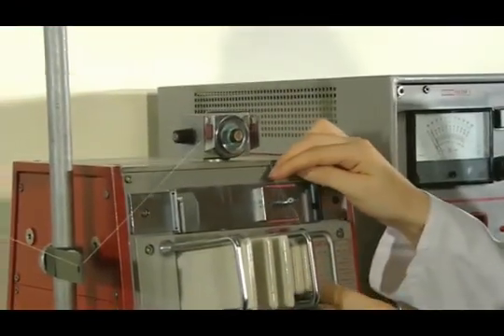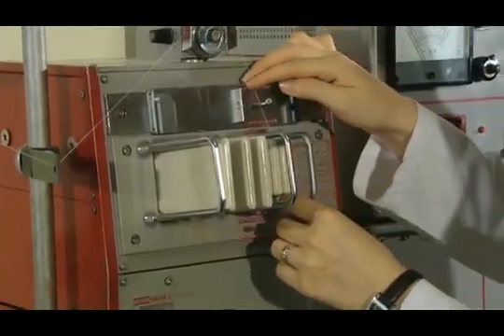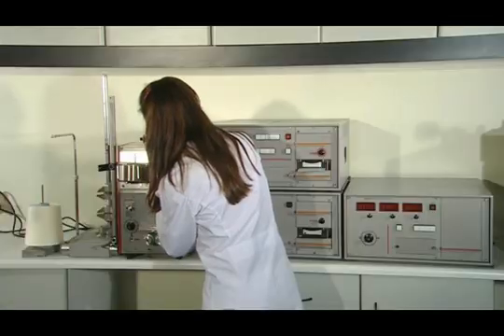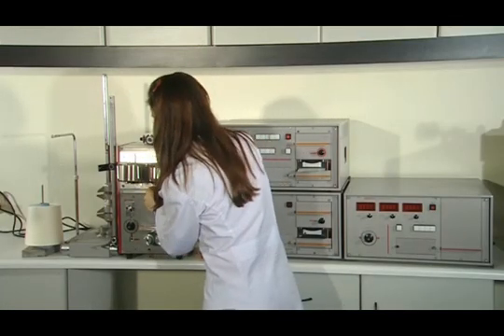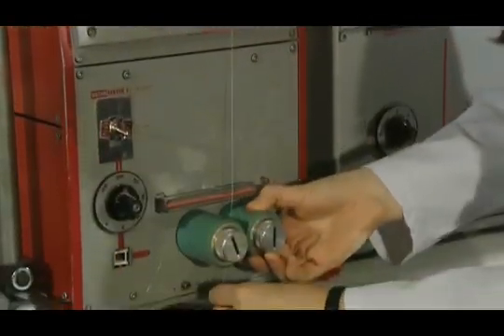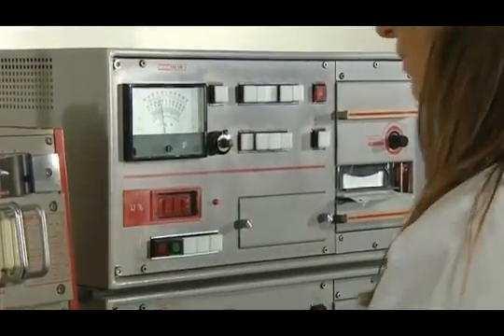Secondly, we take the yarn out of here and pass it through this place. Afterwards, it is passed through the plates where there is an electric current. The suitable plate is selected according to the yarn number, and for us, the suitable plate gap is as seen. Then we pass it through those aprons again.